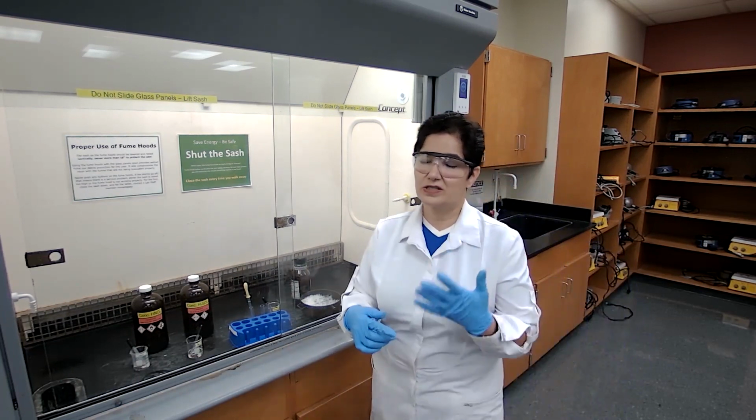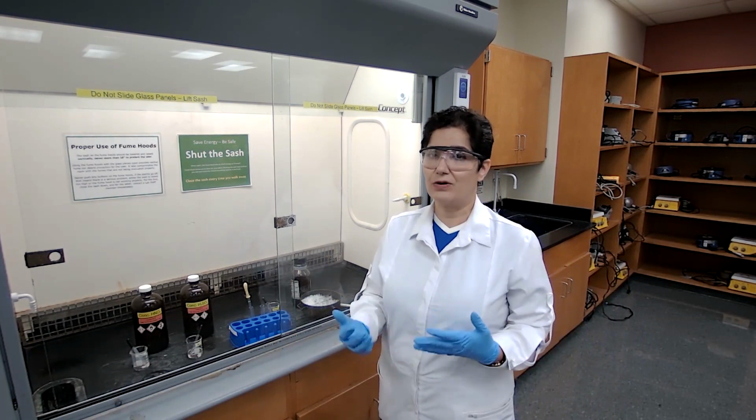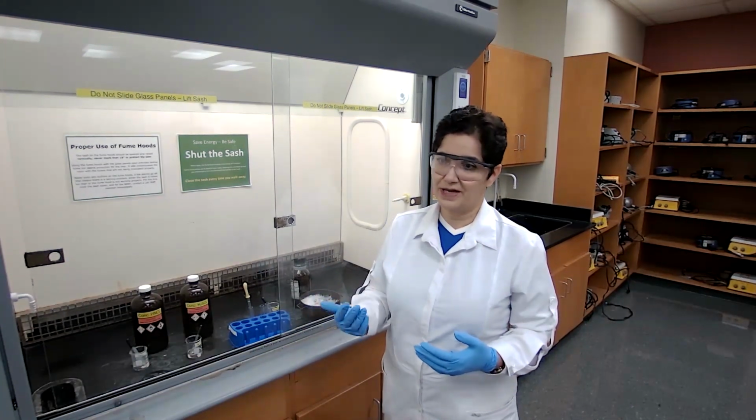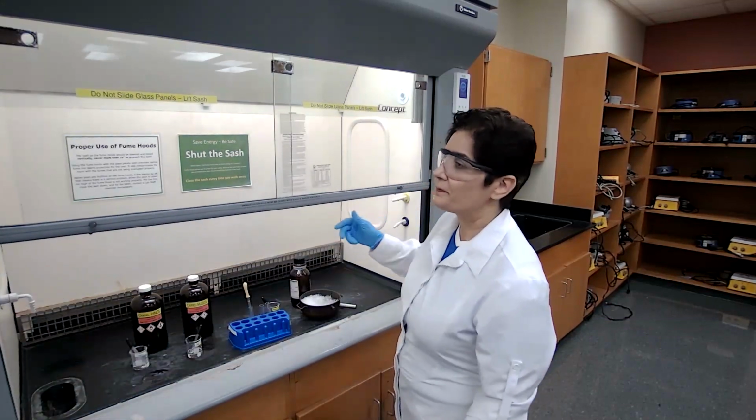But watch the pre-lab discussions. I actually write the formulas, and you could see the explanation and the formulas or chemical reactions for this experiment. Let's go ahead and measure the chemicals.